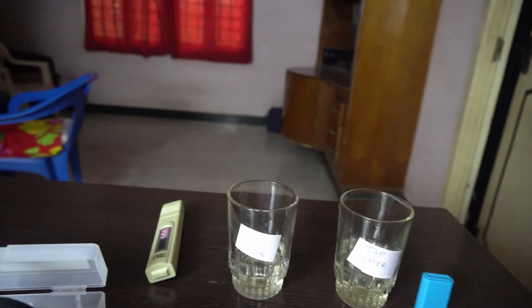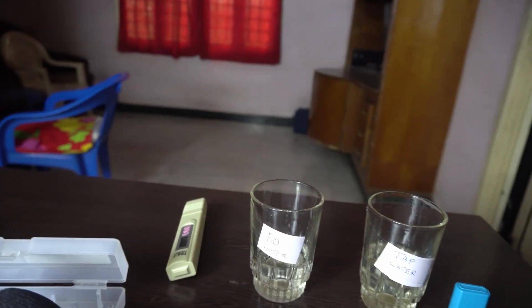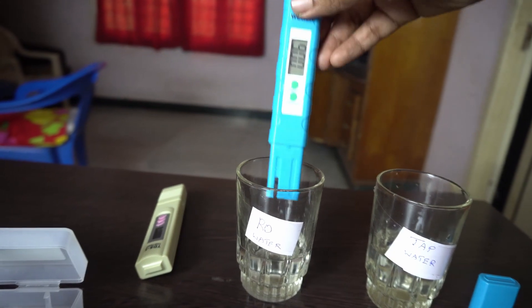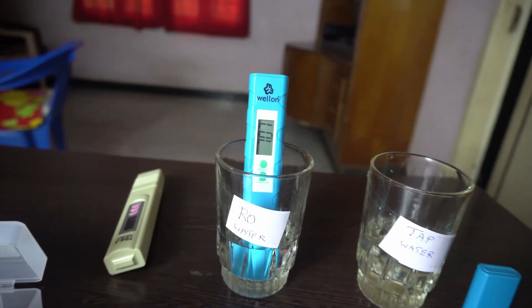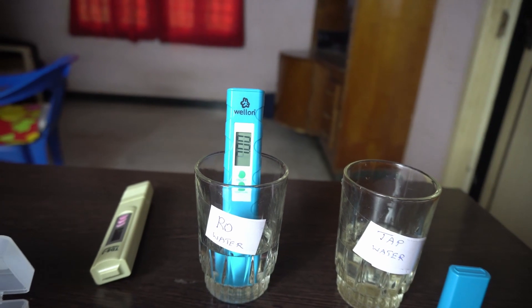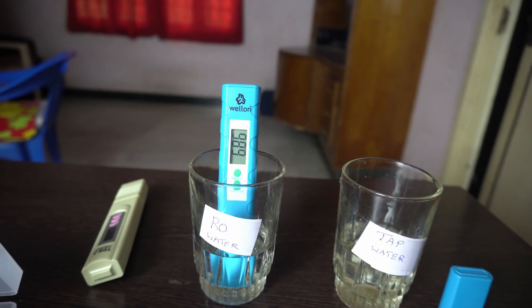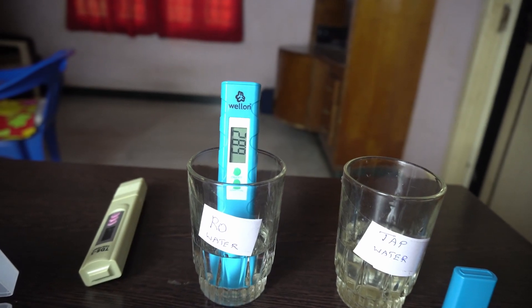Next, we check the RO water pH value. So RO water is tested now. Let's check the pH value. The reading is coming in — first showing 6.83.